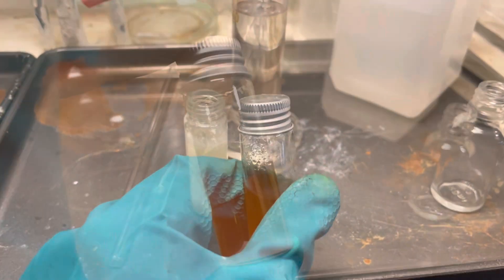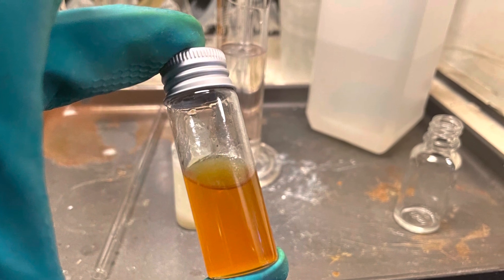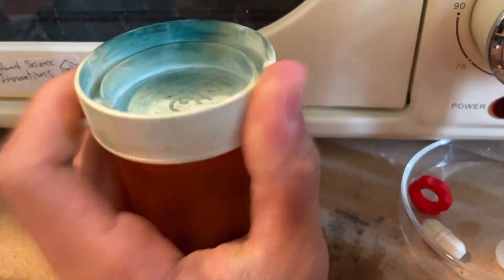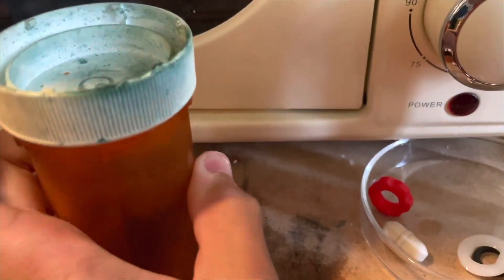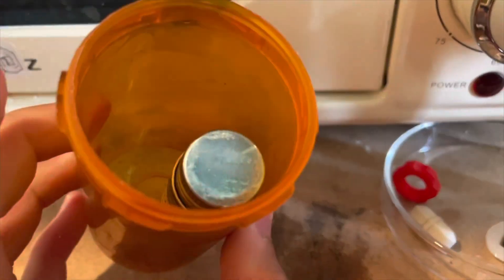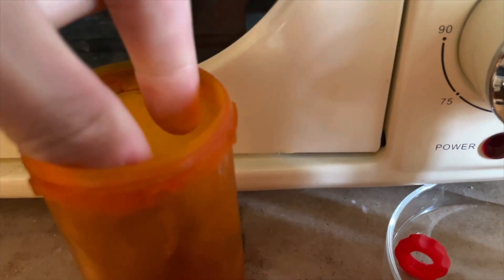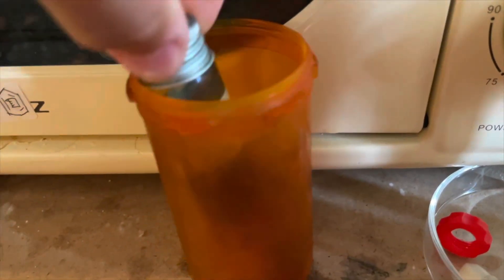Here's our phenyl isonitrile and ethanol — it's crude, of course. I'm not even gonna dare dry it because I do not want to handle it more. This is how bad it is: I put it in a plastic jar in my freezer and it still stinks. The lid itself smells horrible. I regret touching it with my hand. This stuff is very potent. I do not want to deal with this ever again.